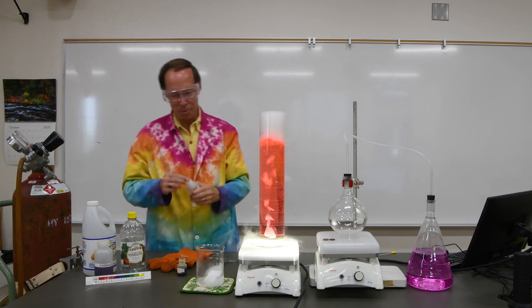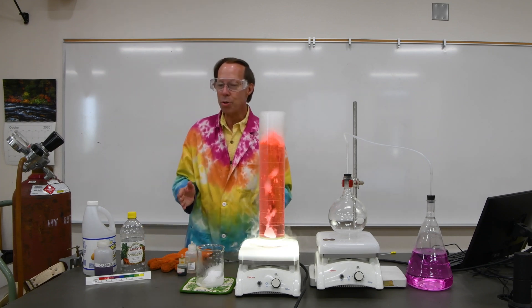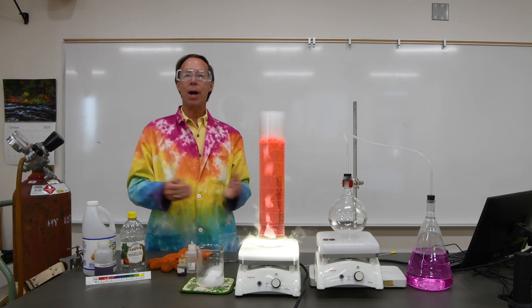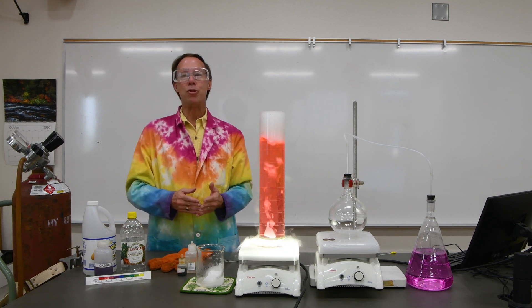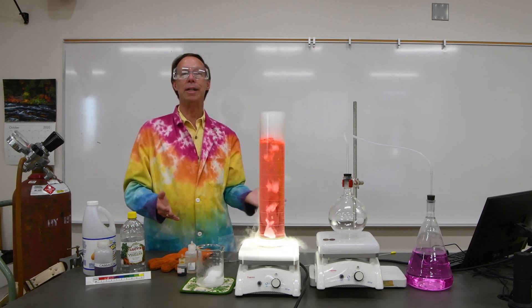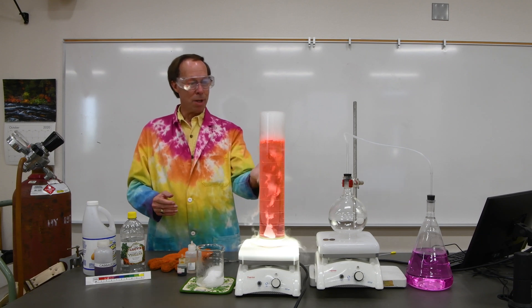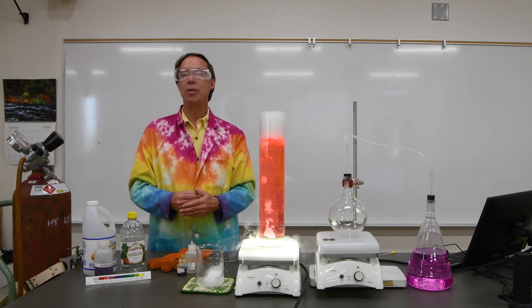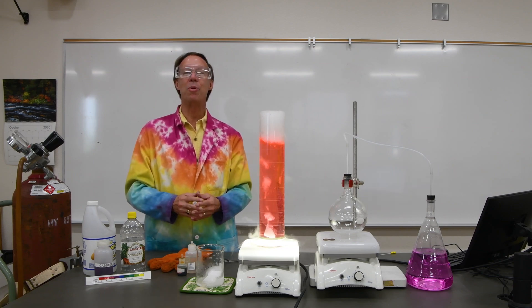So this is a very fun demonstration to do. You can also do this with cabbage juice. If you wanted to do this at home, you can buy dry ice at the grocery store — that's where my dry ice came from. You can make cabbage juice just as I'll illustrate in the lab video for this week's lab, and you can do the same type of thing in any glass container you happen to have at home. It's a great thing to do for Halloween.